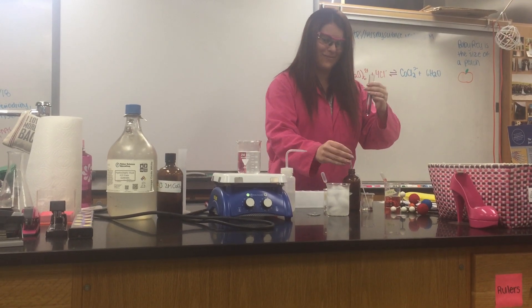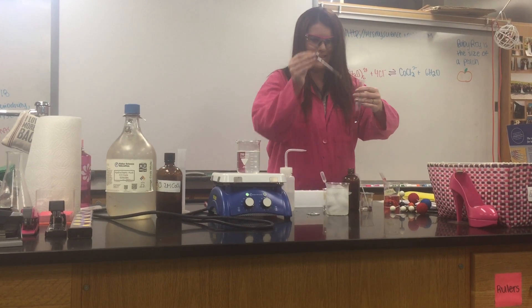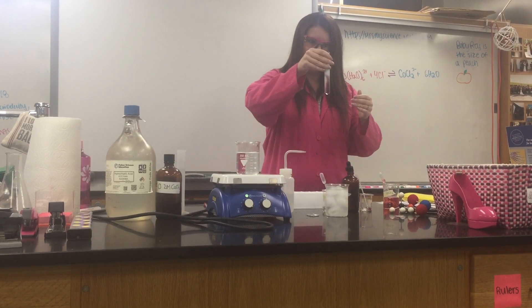Now we are going to add silver nitrate, which is going to remove chlorine — shift it back to pink.